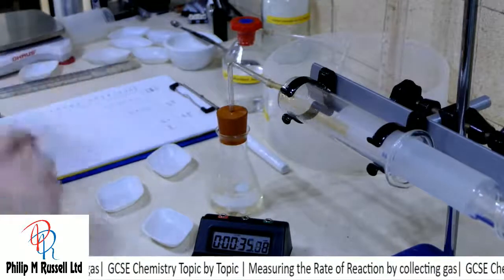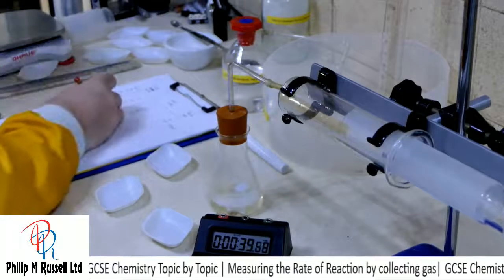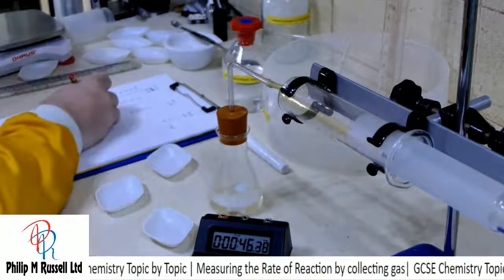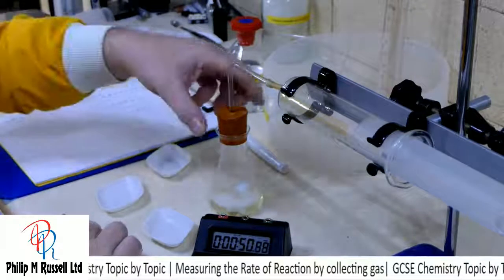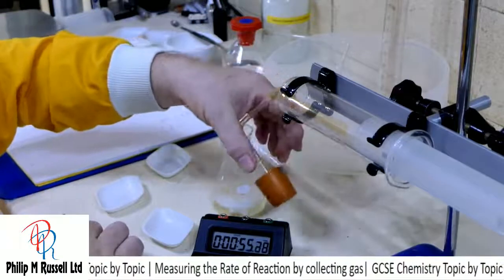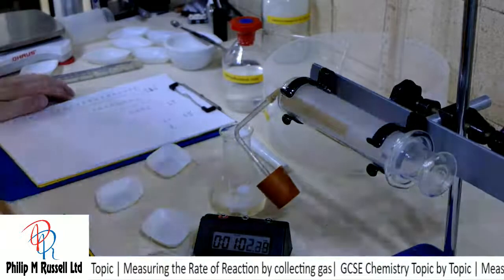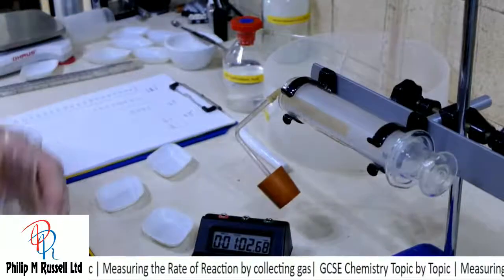These are going quite nicely. 35 seconds I've got 81. 40 seconds I've got about 91. And at 50 seconds we're bust. And I can stop this reaction. And what I'm just going to do is I'm just going to pour the acid away.